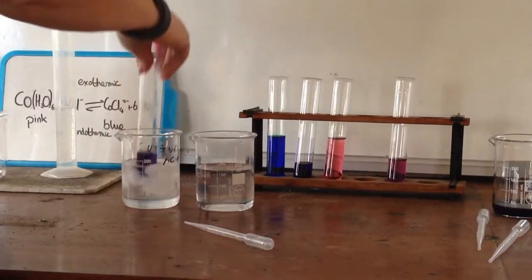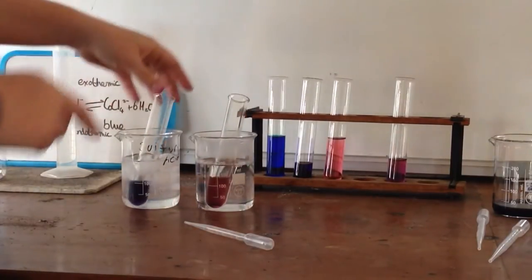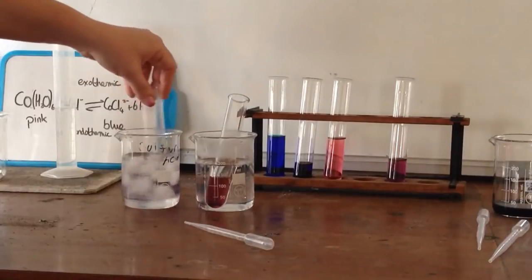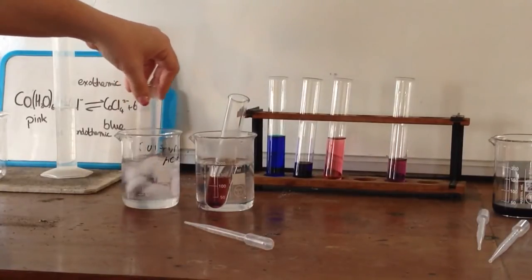Now what I'm going to do with these, this is hot, this one is cold. If I just switch those over, we should see them reversing color.